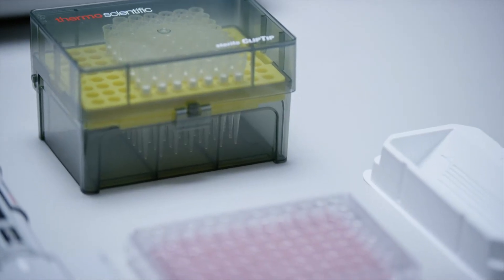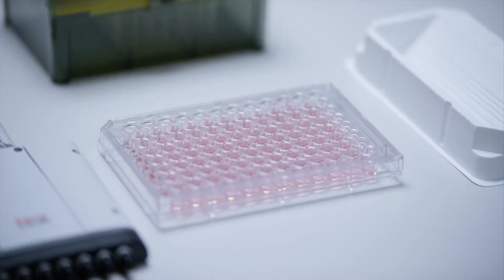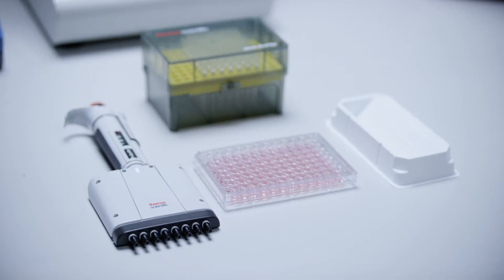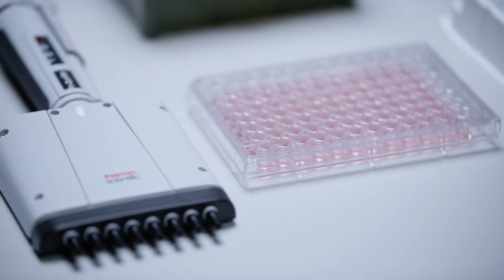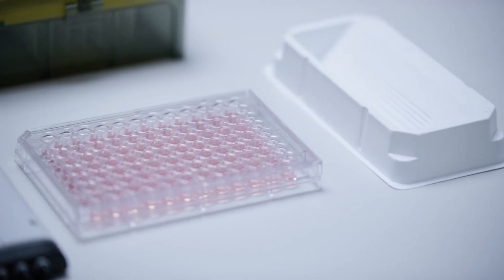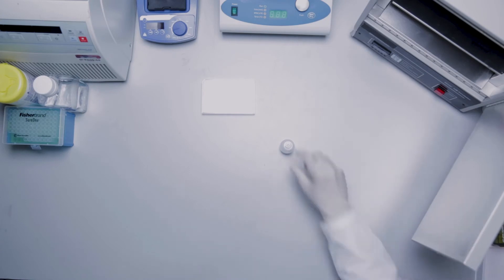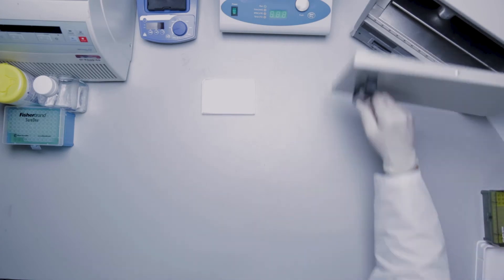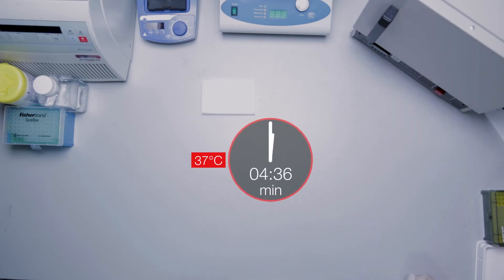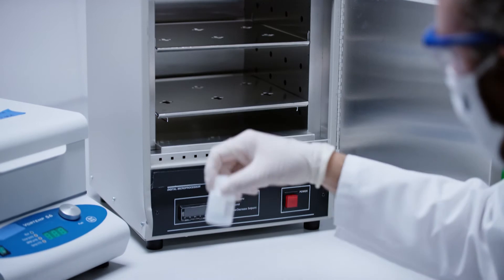Growing your cells in a 96-well or 384-well plate format and using multi-channel pipettes and reagent reservoirs allows for an easy and efficient workflow and a faster time to results, as long as this format is appropriate for your specific cell type and experiment. To lyse cells in a 96-well plate format, first pre-warm the lysis mixture at 37 degrees Celsius for 30 minutes, followed by gentle swirling.